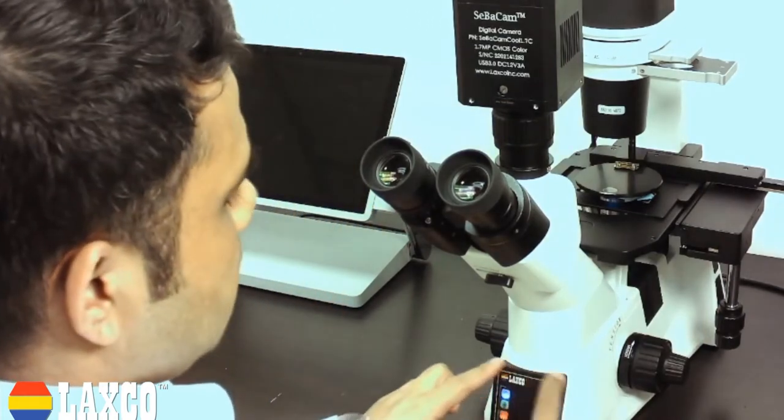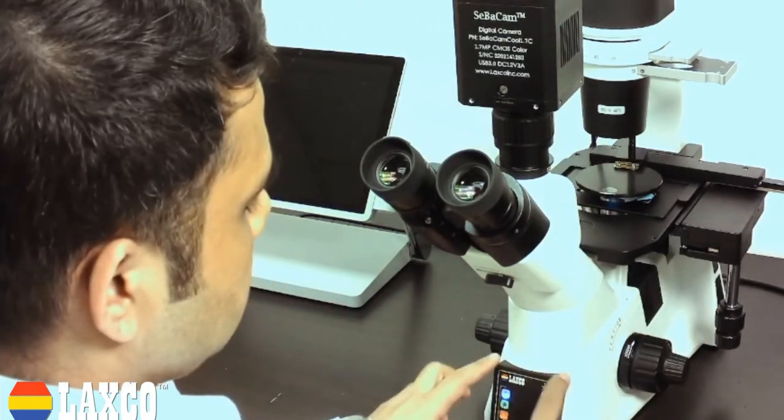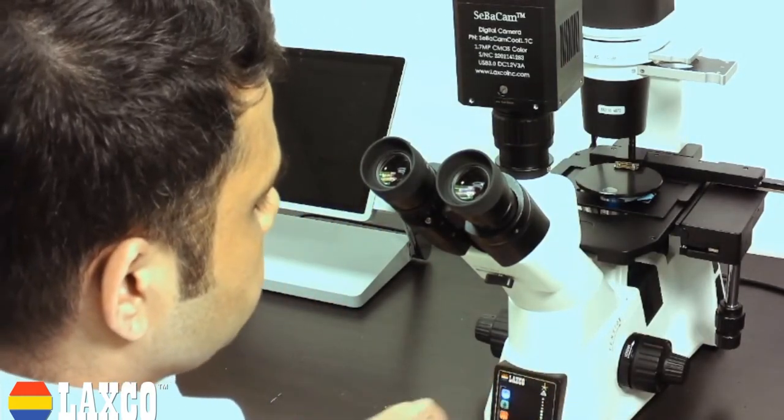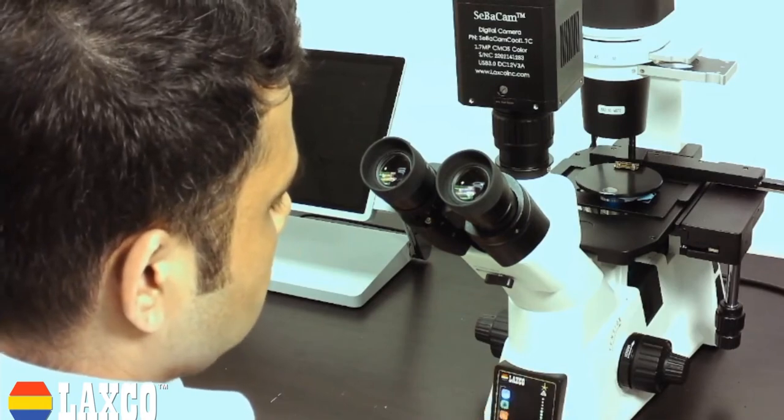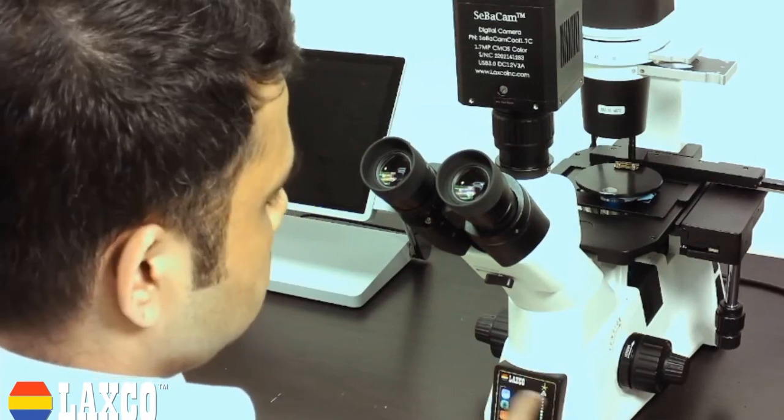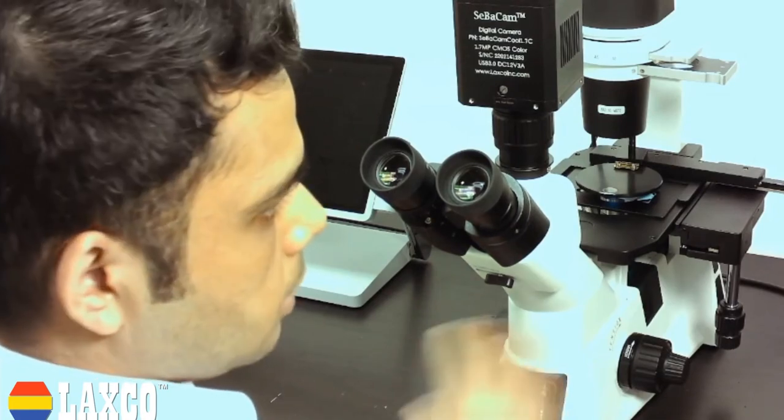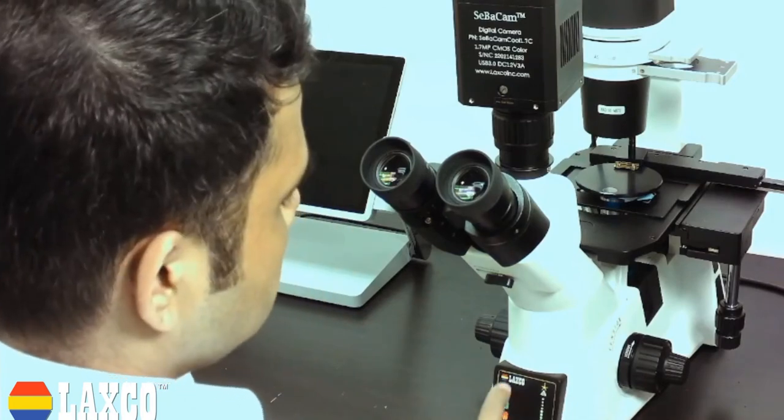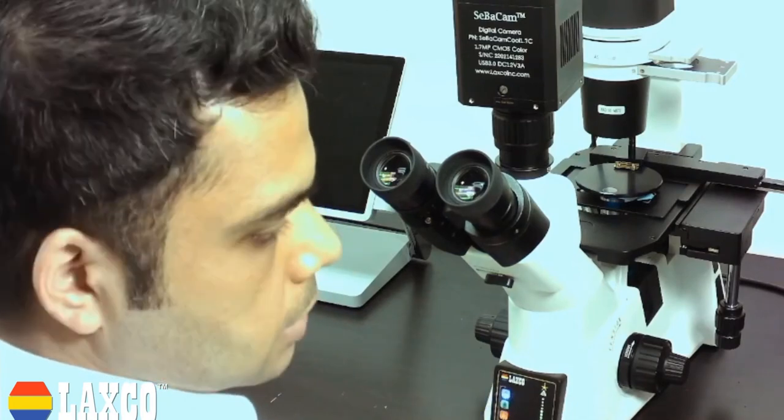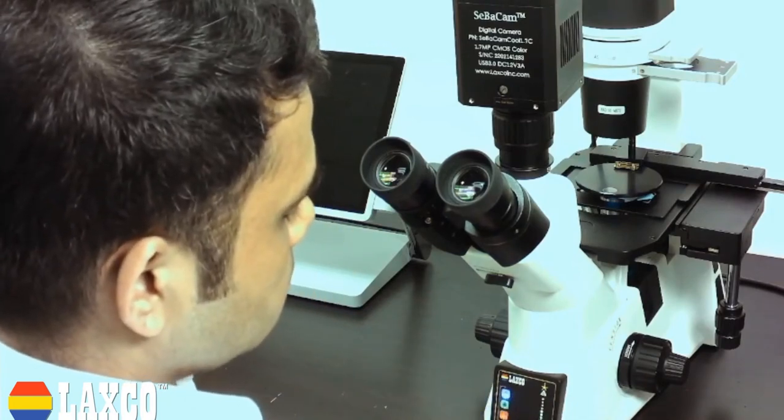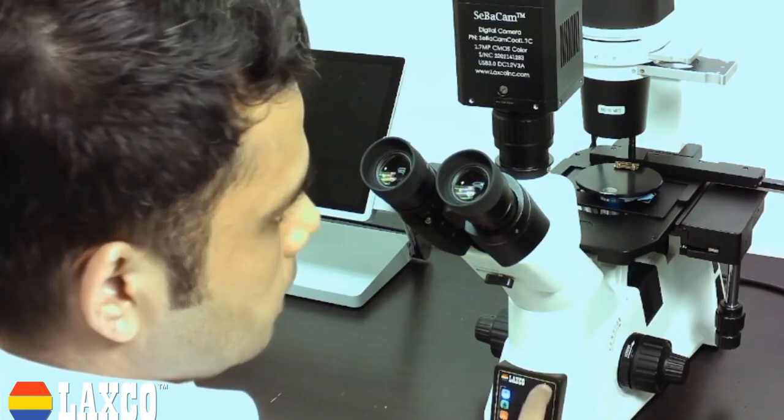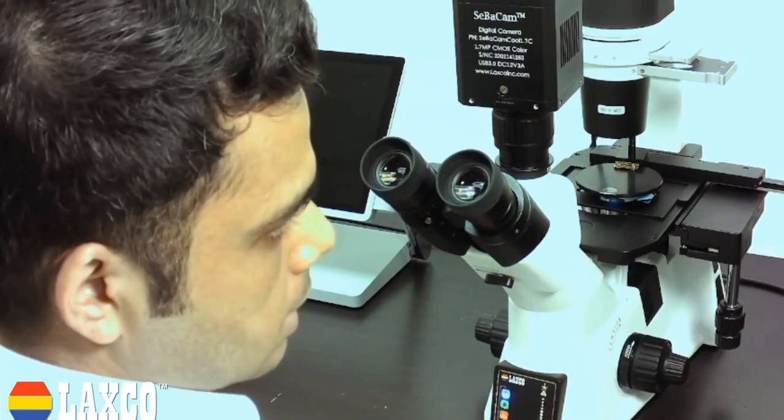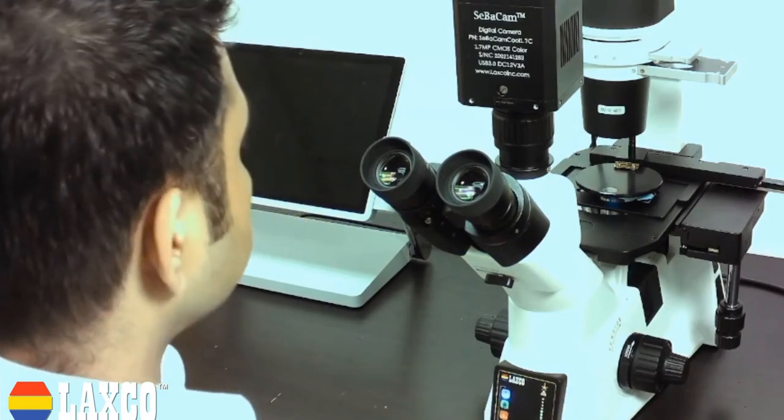Let's look at the front touchpad panel here now. This basically has all the controls that you need to control all the illuminations on your system. You can control your fluorescent channels, you can control your bright field, and you can also change the intensity using this particular area.